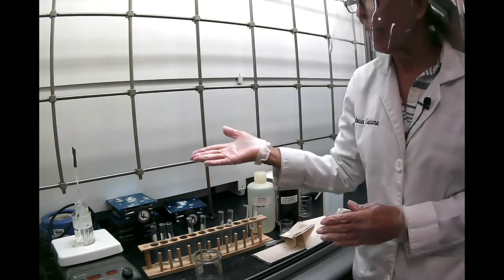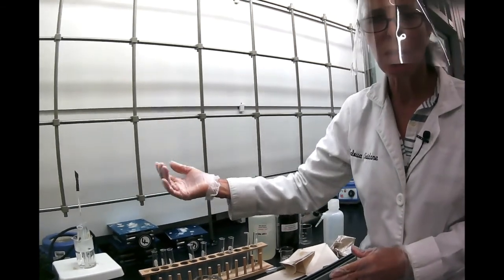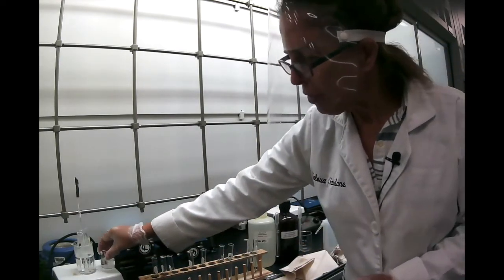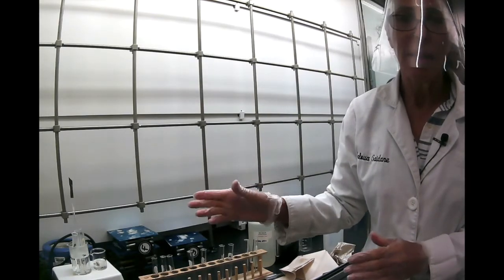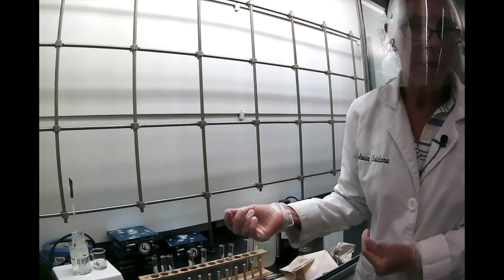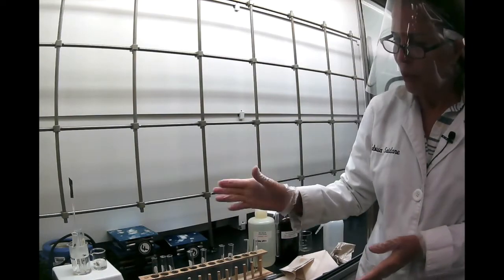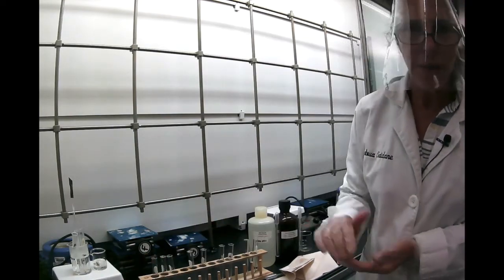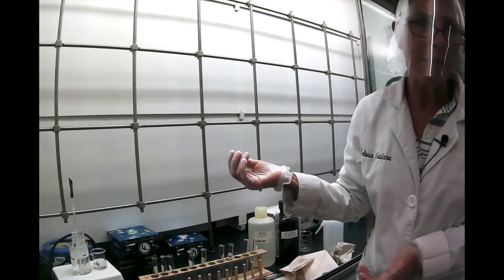Now, one thing that can happen in the process here is that as you heat it, you might lose some of your water. So it's a good idea to have a little bit of hot water on the side to keep adding in case it evaporates. It takes a little patience to wait and see. The idea is to make sure you don't have too much water evaporating so that you're consistent with your observation. So for every sample, you have about the same amount of the sample and about the same amount of the water.